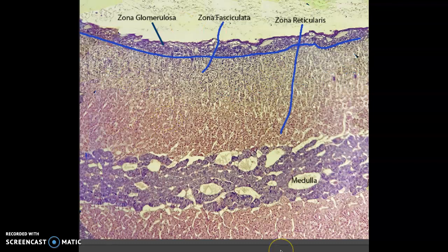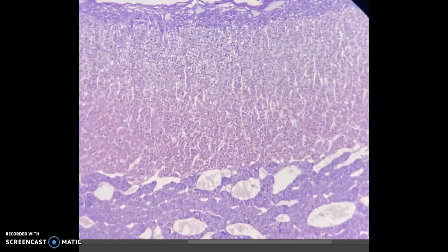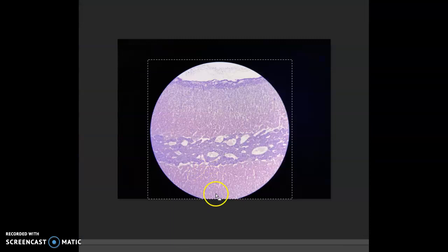Again, as I said in the video, I will pick a Photoshop version online. This was the original slide, so here's the glomerulosa. The fasciculata is right there, and again, I zoomed in. Oops, too far. And I could still see on this, this is my untouched master image that I'll actually do later, that it's right here. That's a definite different color than down here than my medulla is there. And then again, it repeats itself on the other side. So sorry about the confusion. Thank you.